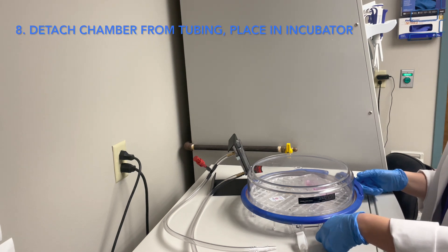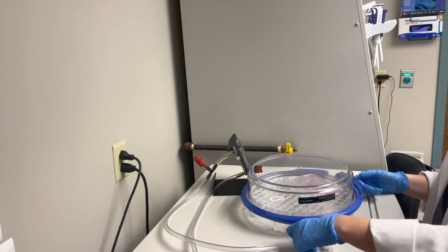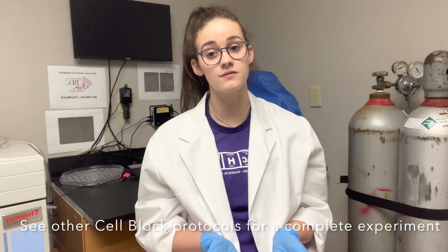I can then disconnect the hypoxia chamber from the tube connecting it to the gas source so I can place it in the incubator. Now I have successfully purged the hypoxia chamber and sealed it off with my cells inside. I can take the hypoxia chamber and place it in the incubator for a set amount of time. Again, based on your cells and your experimental needs, your time under hypoxia may vary — four hours might be a good place to start. If you're planning on using this hypoxia protocol video in conjunction with another experiment, for example a scratch assay, you can see other cell block protocols to help guide you in a successful experiment.